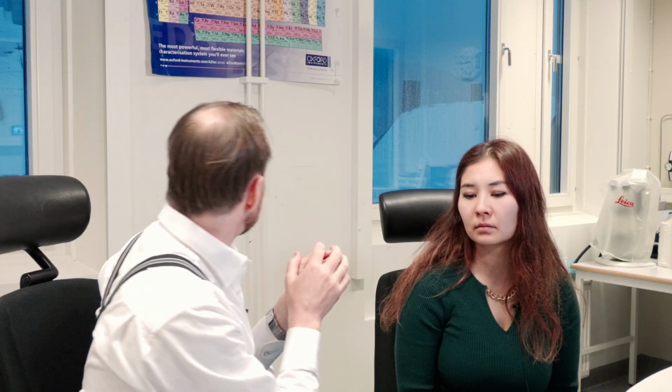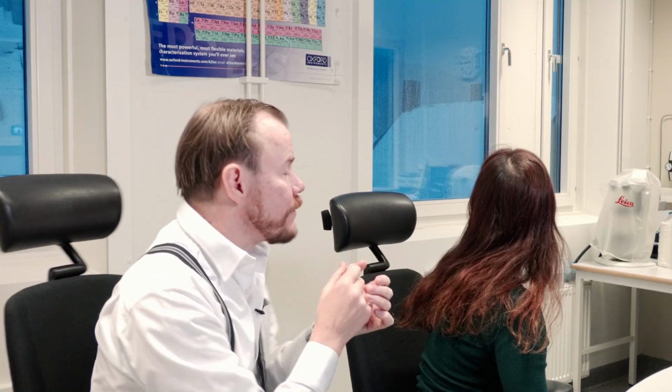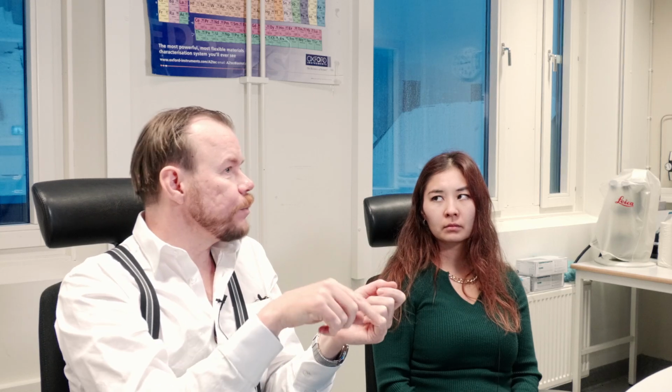Yeah. And carbon has a very low energy signal. It's like 0.5 kilo electron volt or something like that. We can see it's even less, 0.27. So that means a small energy X-ray is easily absorbed also. So then it says, okay, if this is carbon emitting X-rays and we're measuring a lot of those X-rays, then there must be a lot of carbon inside that steel matrix, since steel is a very solid material around it. So it must be a lot of carbon, and then in the calculation, it must be 30% carbon to get that kind of intensity.